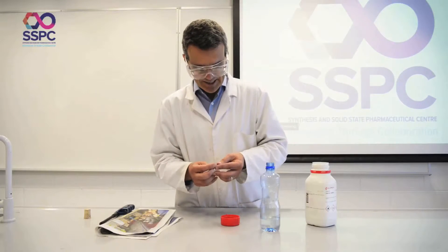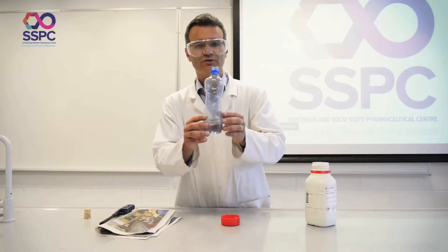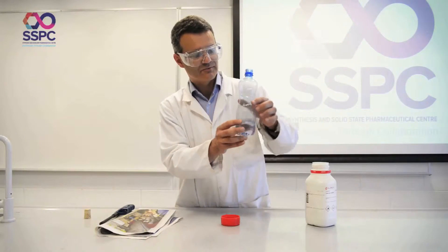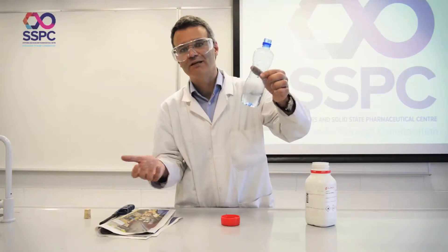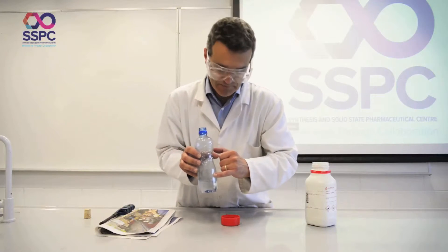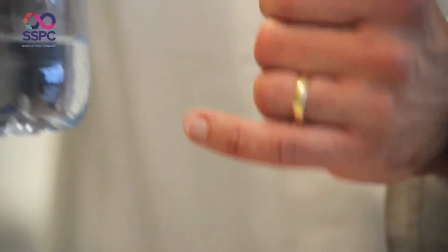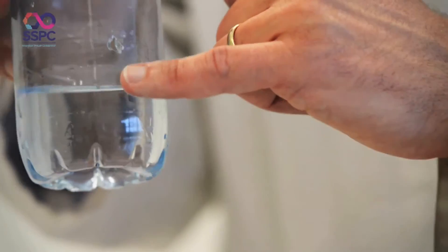The idea here is that I have a bottle — an ordinary 200ml or so normal drinking bottle — and I've just punctured a small hole in it, a couple of inches up, and filled it with water just below the level of the hole.